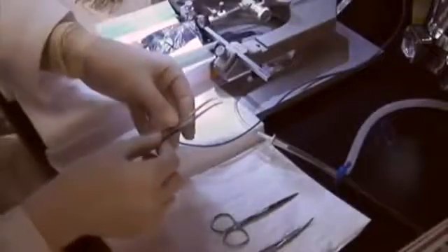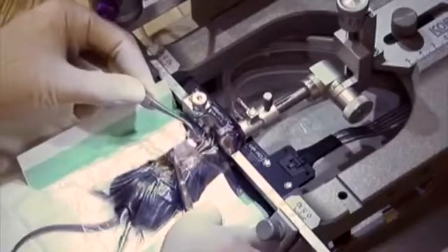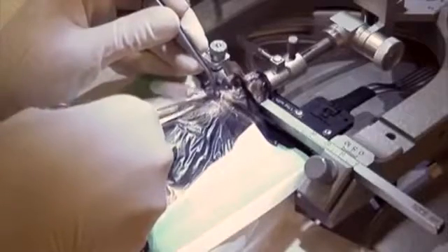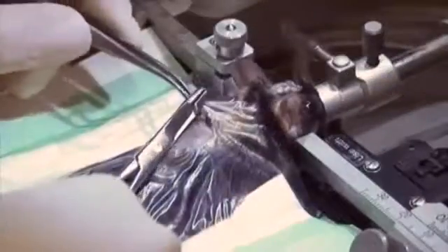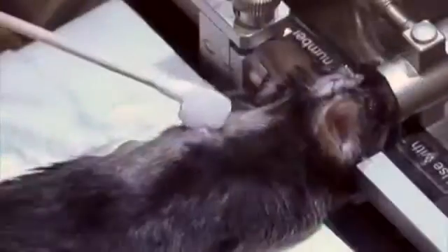To remove a spent pump, carefully pull the pump out of a 1.5 cm incision made perpendicular to the pump junction on the back of the mouse without significantly pulling or pushing on the tubing. Next, clip the tubing approximately 0.5 cm above the flow modulator and touch the superglue to the tubing to seal it shut. Wait 1-2 minutes for the glue to dry. Place the tubing back into the incision and suture the incision closed.